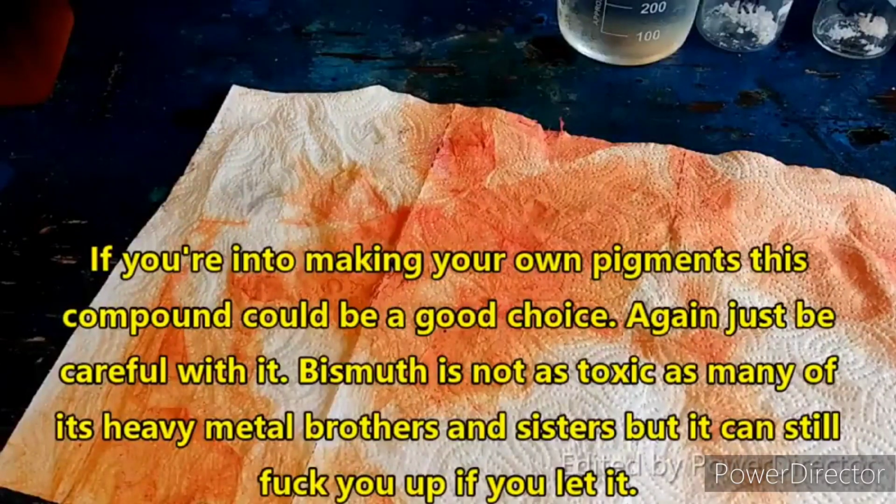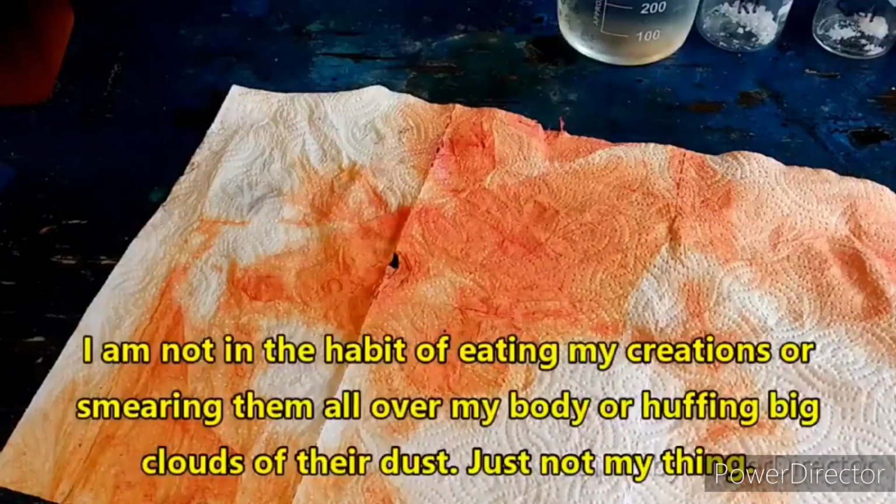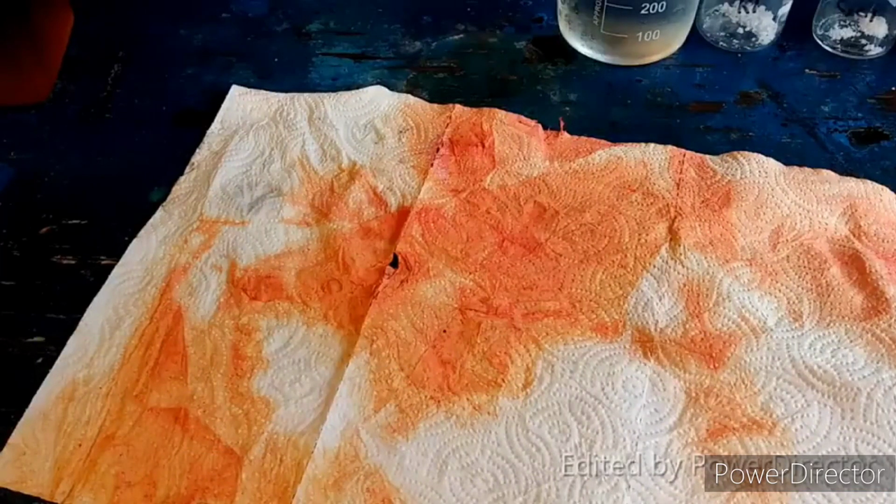I don't think this stuff is overly toxic. Now, I don't know, that is just a wild guess. It could be very poisonous for all I know. It stands to reason that it kind of would be. I mean, any bismuth salt that can dissolve in stomach acid is probably not going to be great for you.